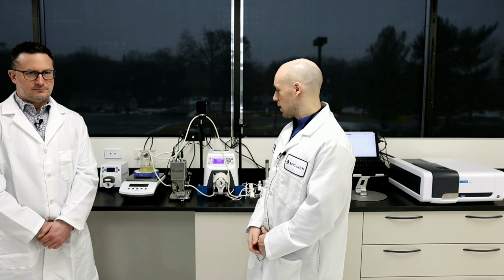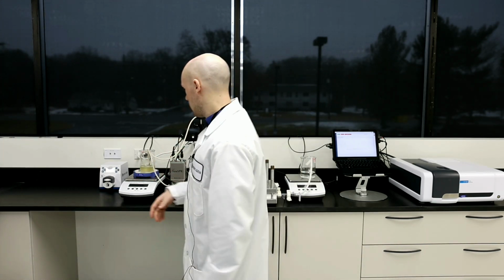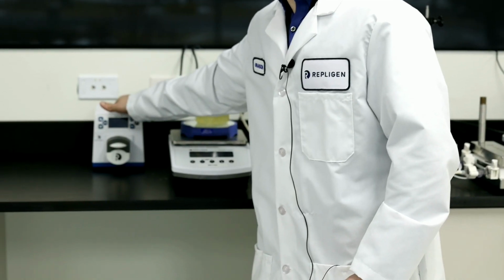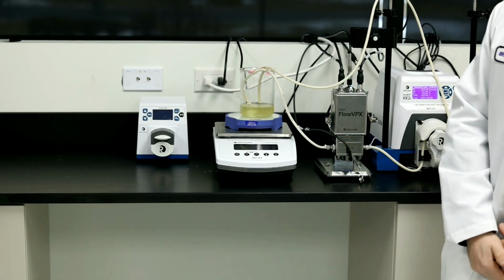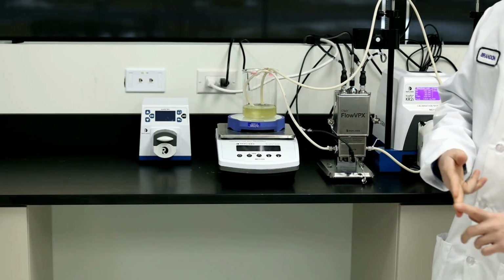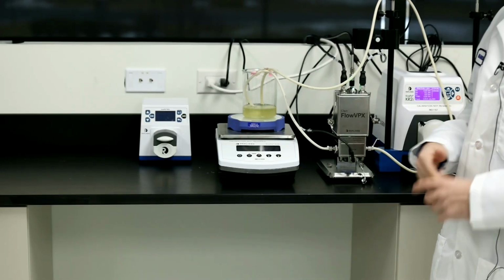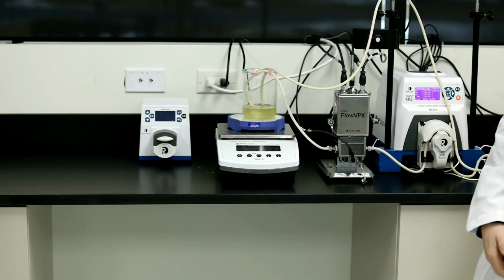But basically, we're going to start from the left side here and actually just go over each part of the system. So on the left, this guy right here, this is our KR Junior pump. This is basically an aux pump used for diafiltration or constant feed. You could have two of them for the actual system. Then we have the feed scale, which measures the weight of how much material we actually have in our retentate vessel.